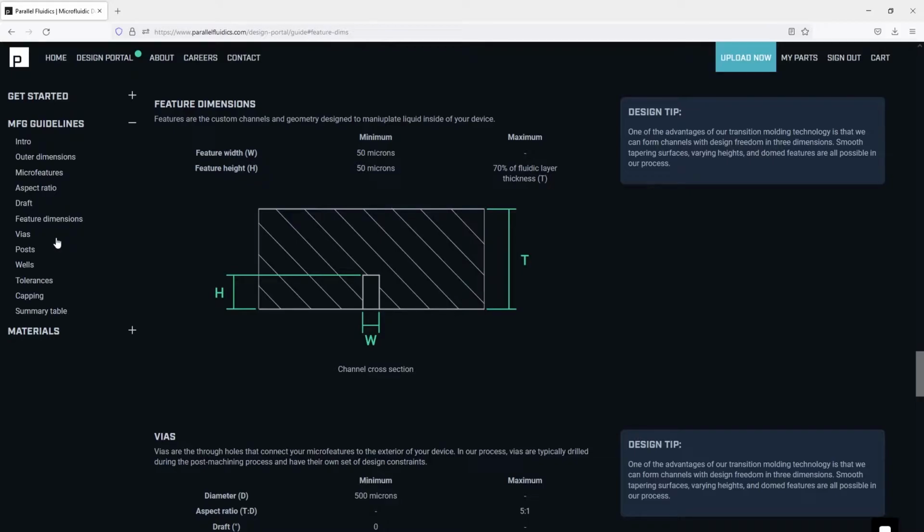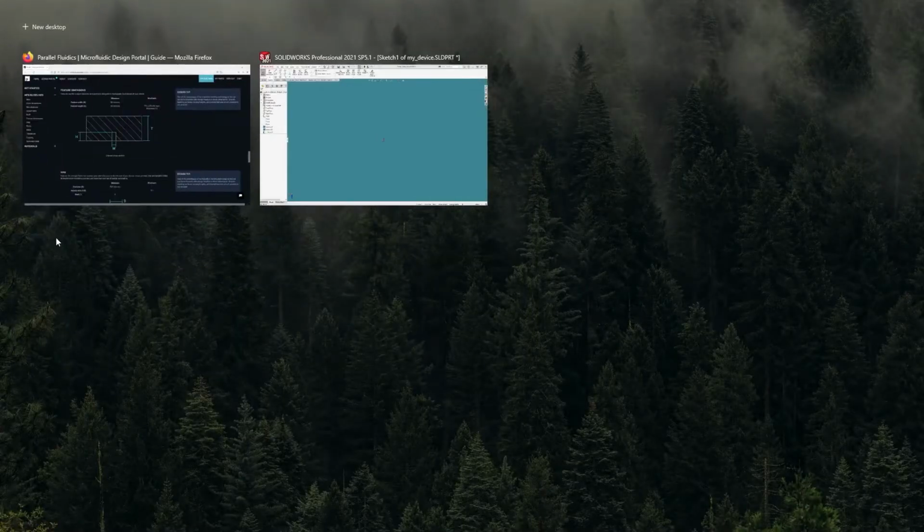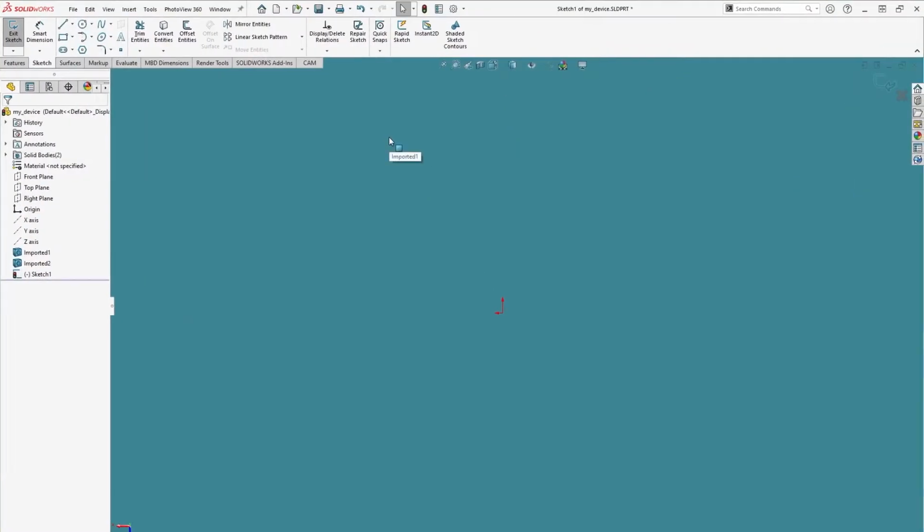For the sake of time, we won't look at the guidelines for every feature today, but it's a good idea to familiarize yourself before designing real parts. Okay, now we'll go back to CAD. The first feature we will sketch is the nozzle with the 100 by 100 micron cross-section. Obviously, the dimensions would need to be changed for your particular needs, but this is just an example for us.